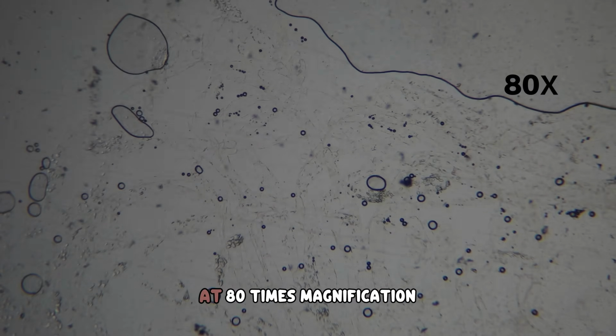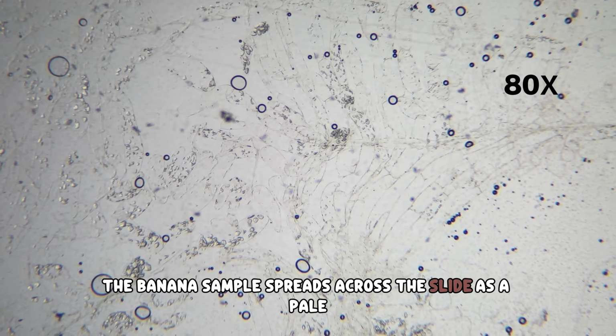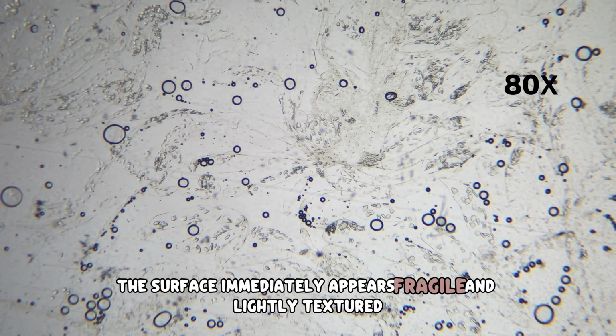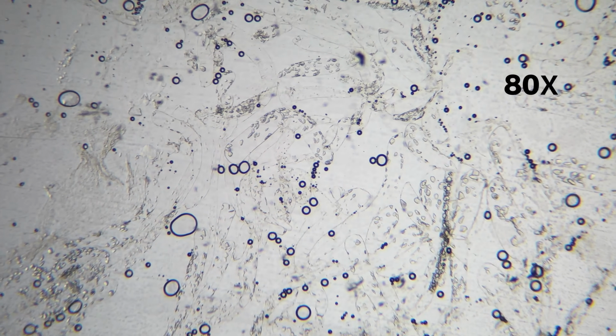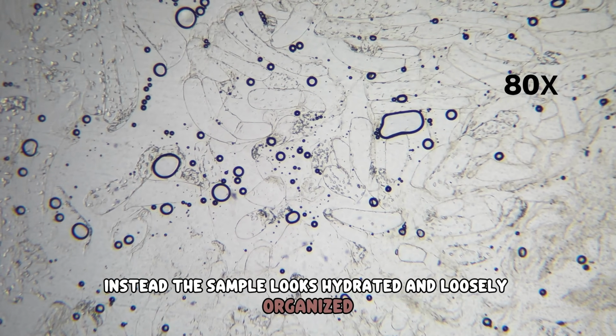At 80 times magnification, the banana sample spreads across the slide as a pale, uneven layer with soft boundaries. The surface immediately appears fragile and lightly textured. There is no sense of firmness or sharp structure at this scale. Instead, the sample looks hydrated and loosely organized.